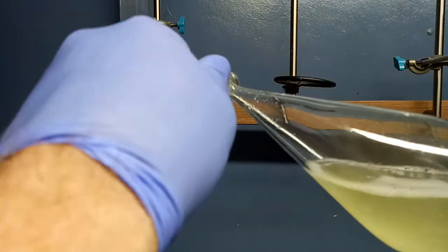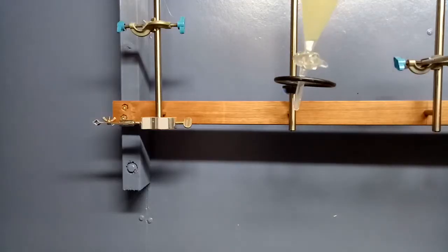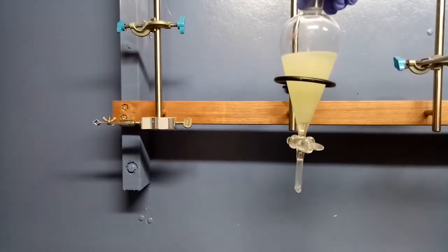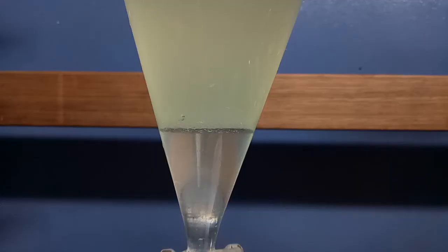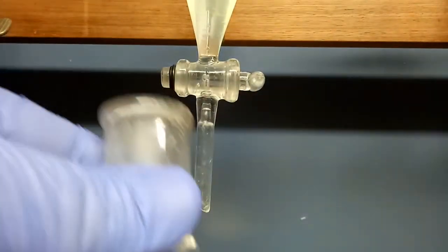I'm using DCM, dichloromethane. The procedure called for diethyl ether. I didn't have any of that, and I wasn't about to synthesize any. Main reason being, it's sitting around about 34 degrees around here at the moment, and that's just too warm to be trying to synthesize any diethyl ether.